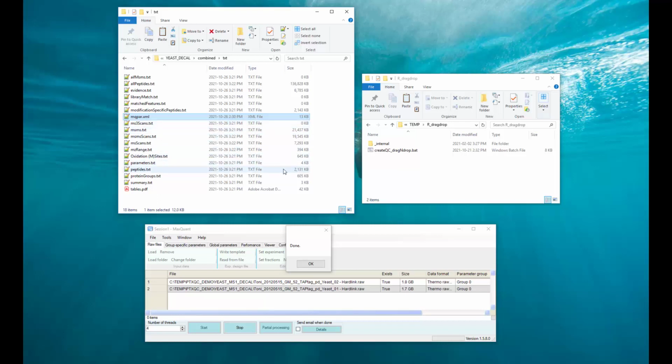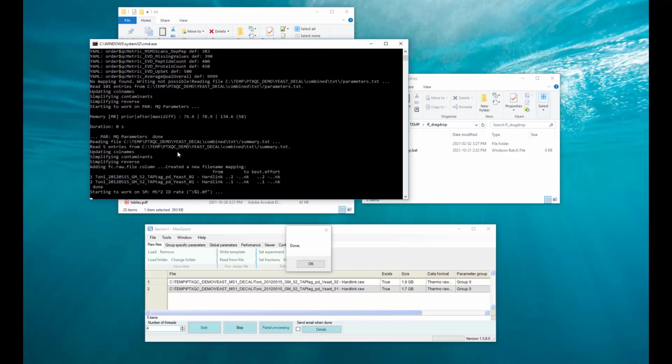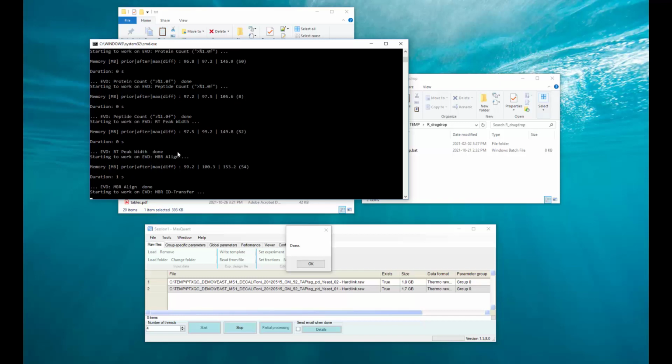Now let's generate the report, which we can simply do by dragging any of these files onto our batch file, and then this neat little window here is going to pop up. PTXQC is going to run. So now let's fast forward till the end and let's look at the result.